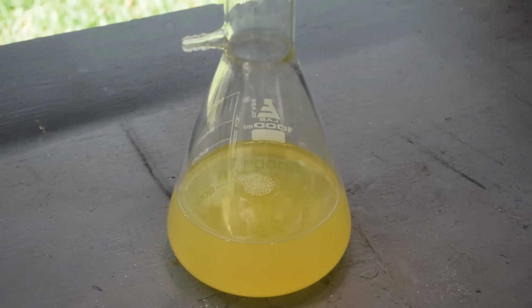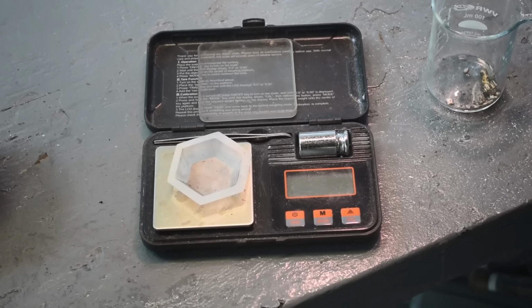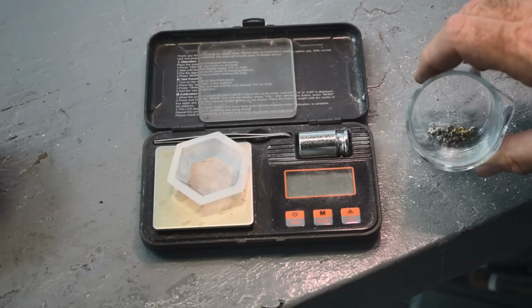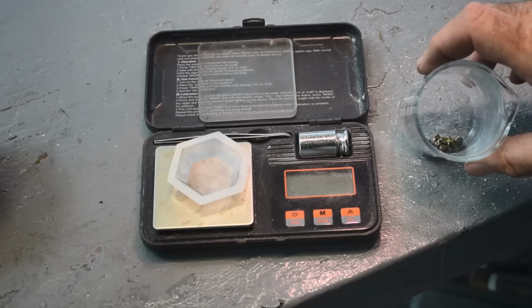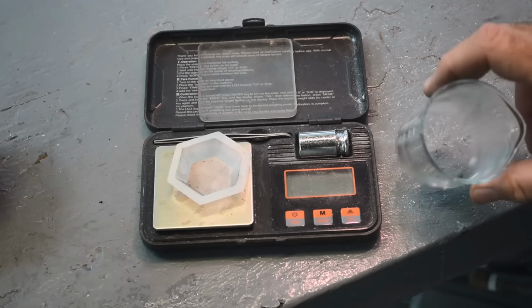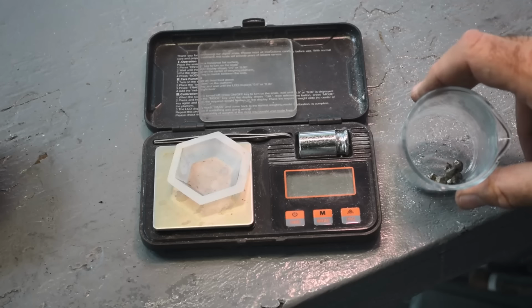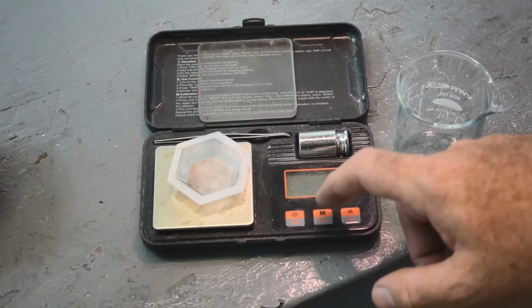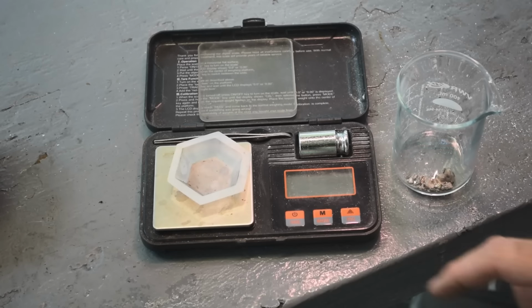Let's see how the stuff in the fume hood's doing. Let's see if we can actually get a look at some palladium and get some kind of weight on some palladium before the end of this fiasco of a video. Alrighty. So here's the metal I managed to recover after getting rid of the borax. A lot of little bits of metal here. We'll see how much it weighs.